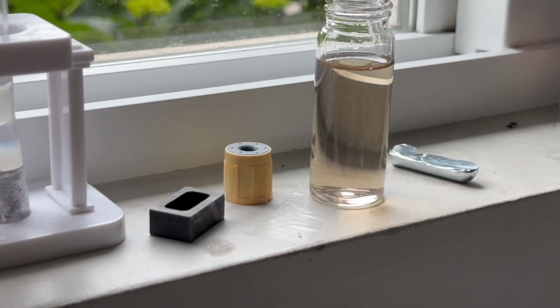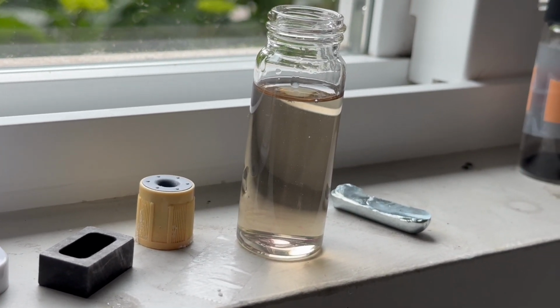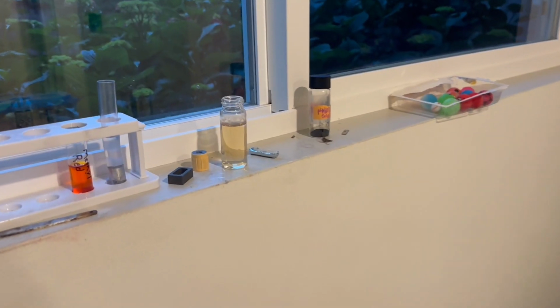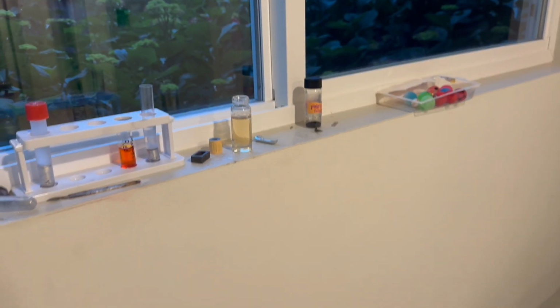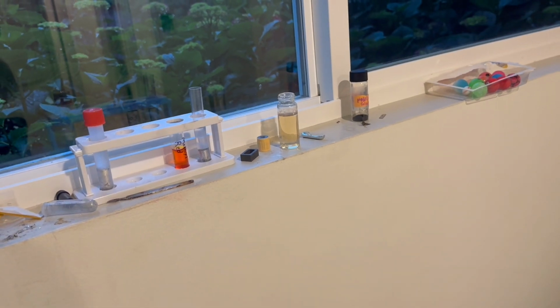Alright, I put everything in this vial, and we're just gonna let it dry. This is acetone, so it should evaporate in like tomorrow maybe. But I'll give an update if it doesn't dry when the video releases. Yeah, no, the video releases tomorrow and it has not dried yet, so I'll post a short on progress when it does dry, so stay tuned, I guess.